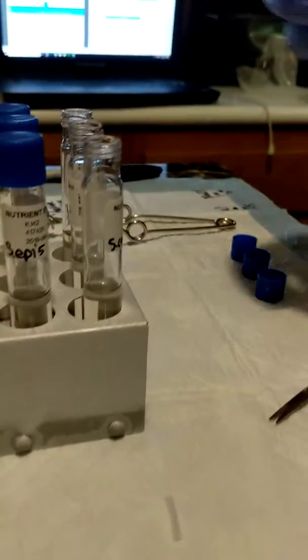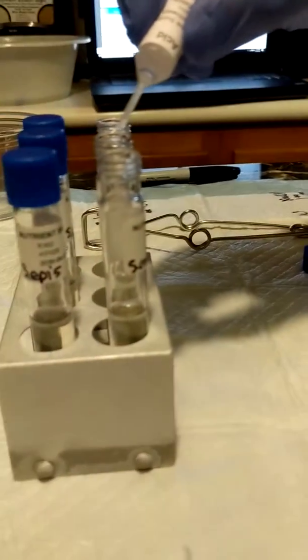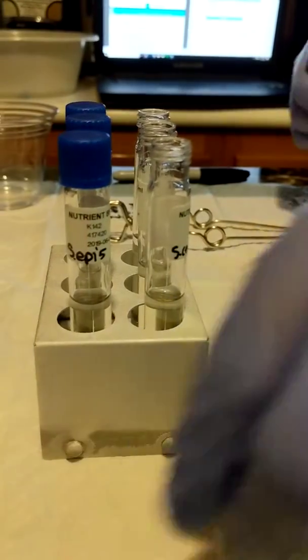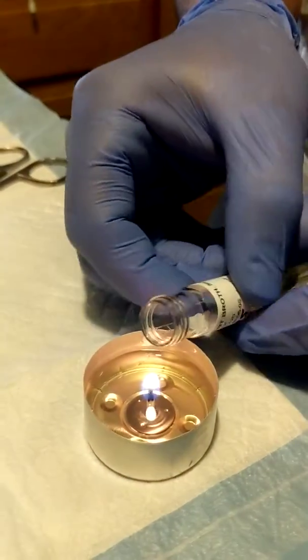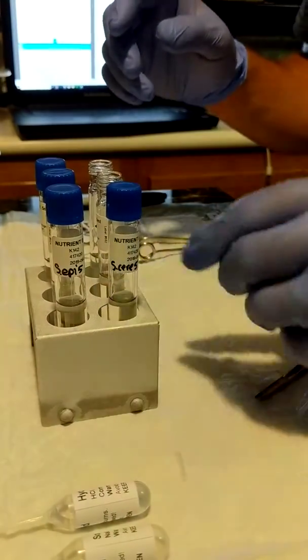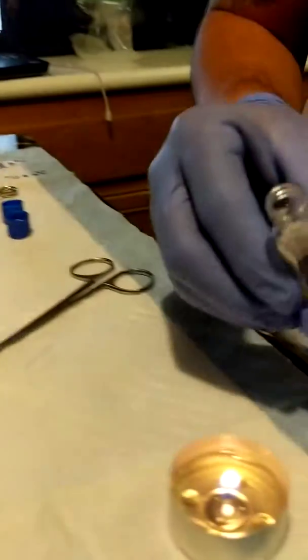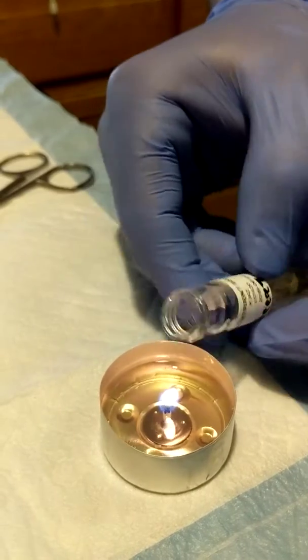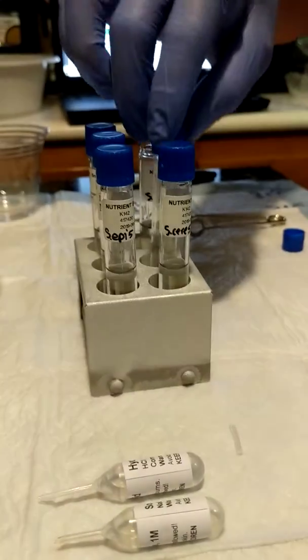And then the hydrochloric acid, pH 5, 1 drop. So hopefully going out of the order of the steps won't affect the results too heavily, if at all. But I guess we'll find out with our experiment.